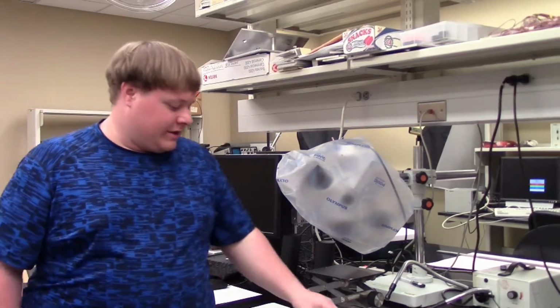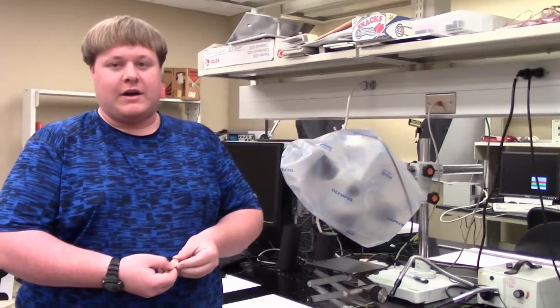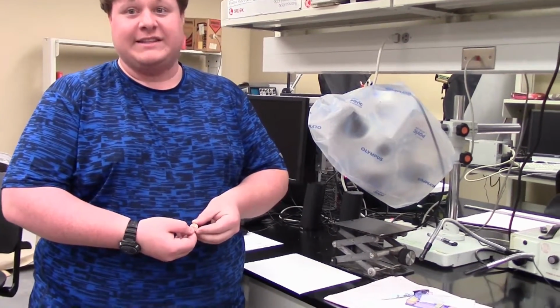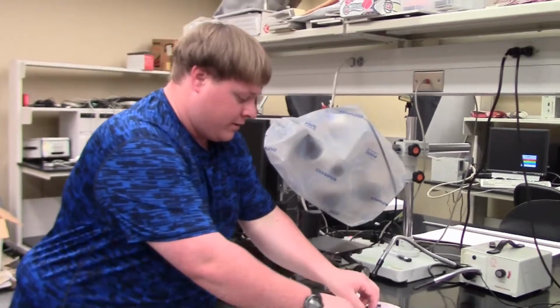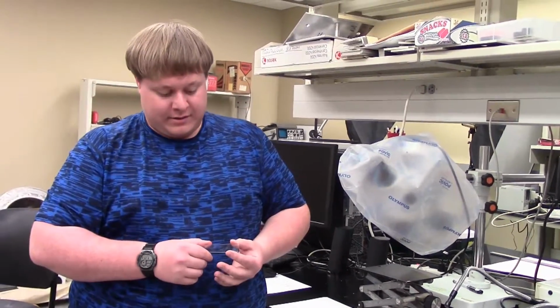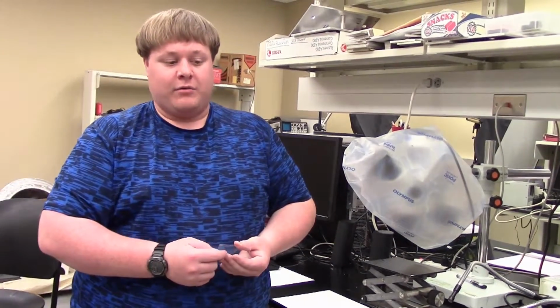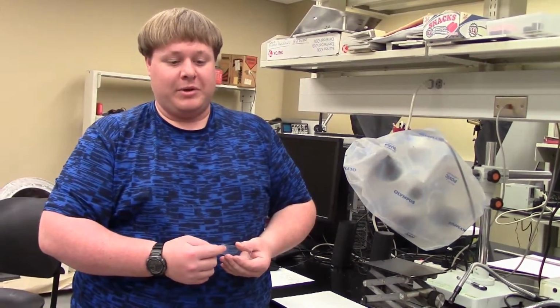This video is designed to demonstrate the use of the microscope for measurements. In this case, we will be using a penny. In particular, we are looking at the T in "cent." But before that, we're going to use this calibration slide. It is a 1 millimeter slide with 0.01 millimeter increments.